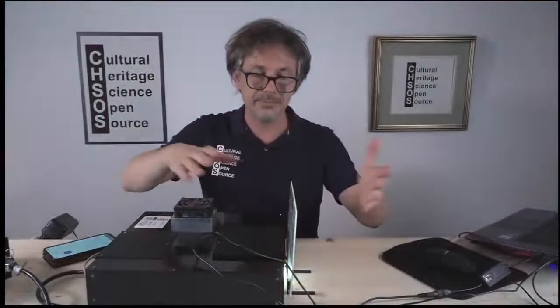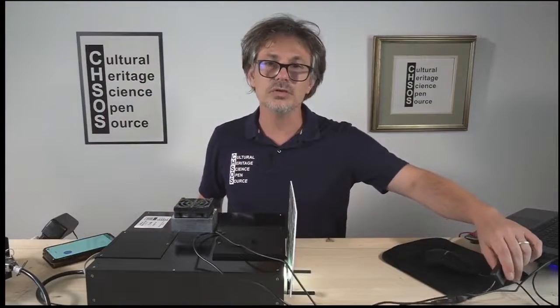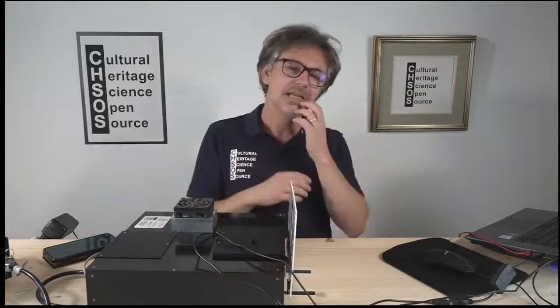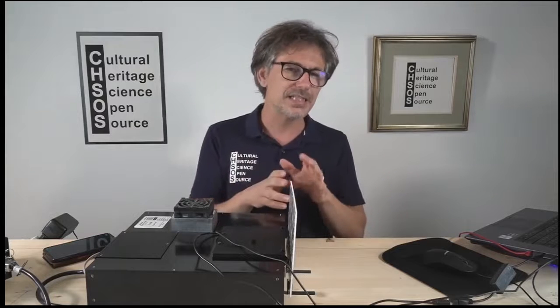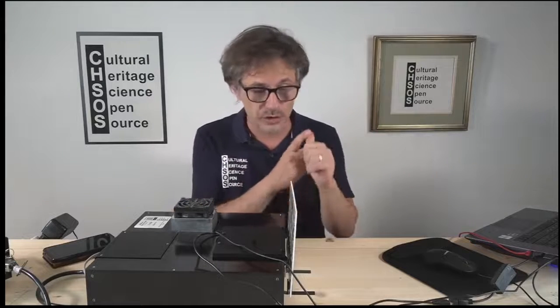And so this is the setup. Remember the pigment checker, the camera. Remember always to turn off the light when you are doing the experiment, otherwise you are introducing noise. The lamp is not introducing specific peaks, but anyway it's noise, so definitely remember to shut it down.